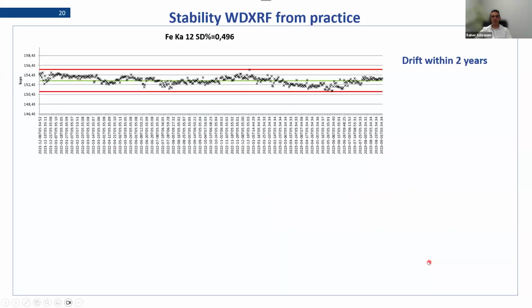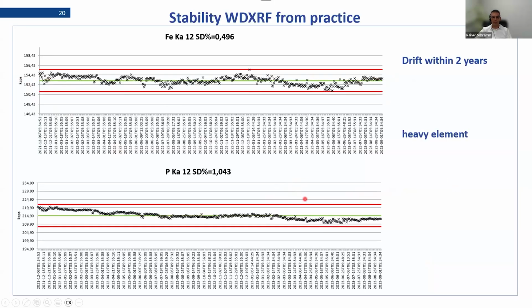If we go into detail, for example, here, iron as a heavy element, you see the very small change over 2 years now. And if you look on phosphorus as a light element, you see really a significant drift over 2 years. And this is just what you see, and this is what I have collected in the 5 years picture, so that you get a feeling on how does a system change over time. This is not critical, this is normal, and with the drift correction, you continuously have to monitor and to perform. You can get this under control.